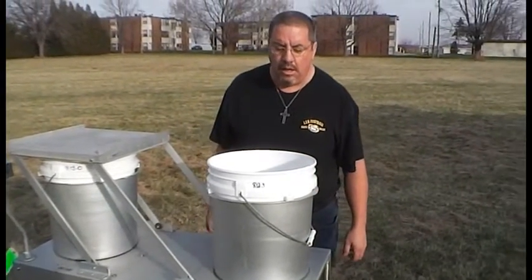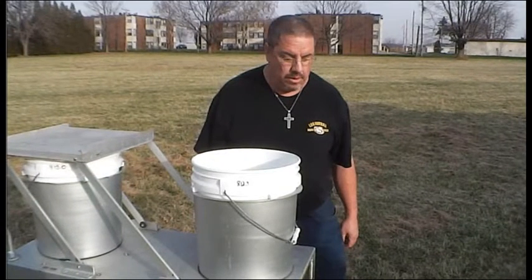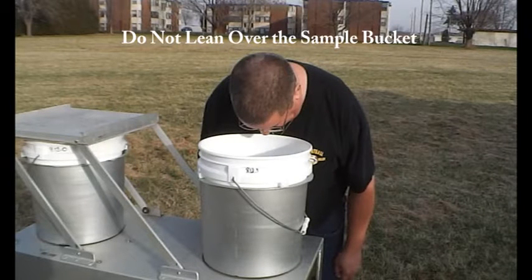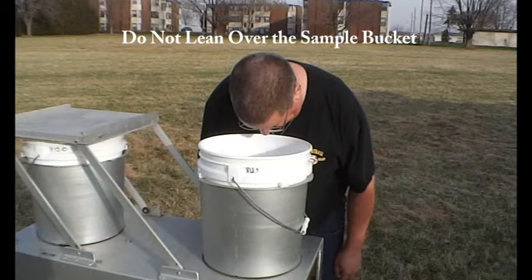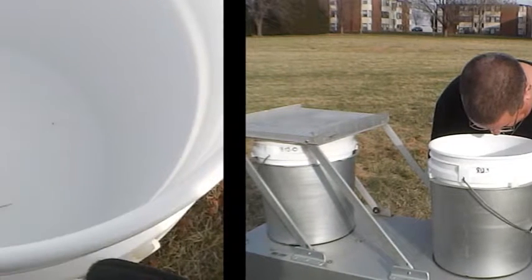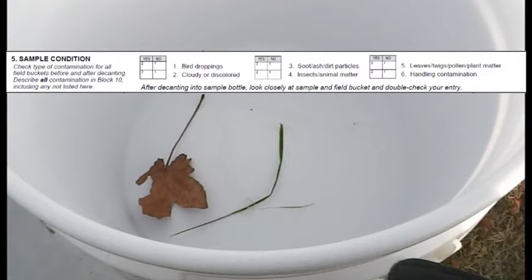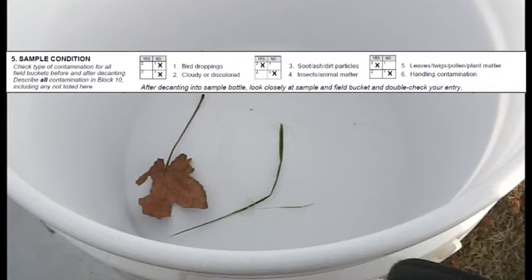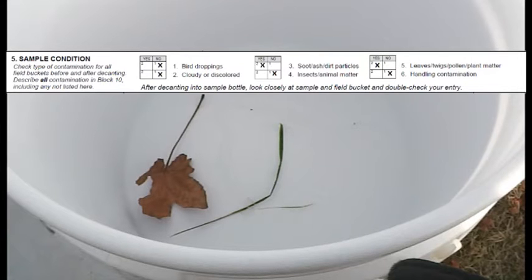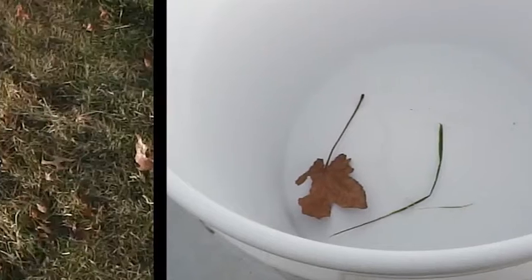When the collector has opened, you will need to inspect the contents of the bucket for contamination, as demonstrated here. While inspecting, do not touch the bucket or directly lean over it, as doing so may lead to sample contamination from human hair, sweat, or clothing fibers. Record any contamination you observe in the bucket. This information is needed to complete Block 5 of your field form. When completing Block 5, remember to check all available boxes in either the yes or no columns. Any additional comments should be written in Block 10, Remarks.